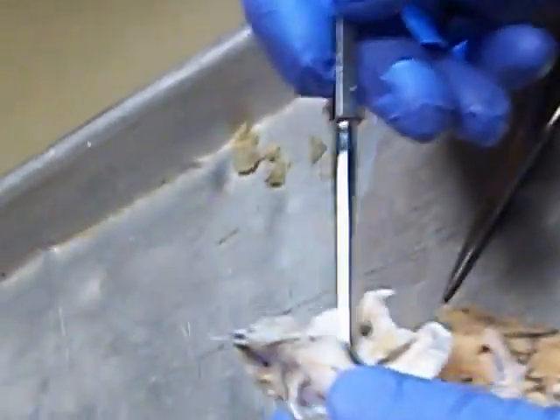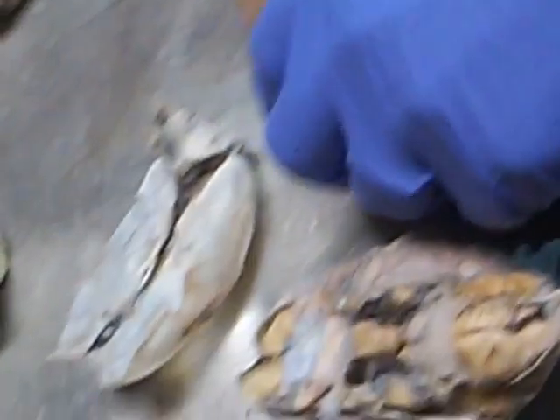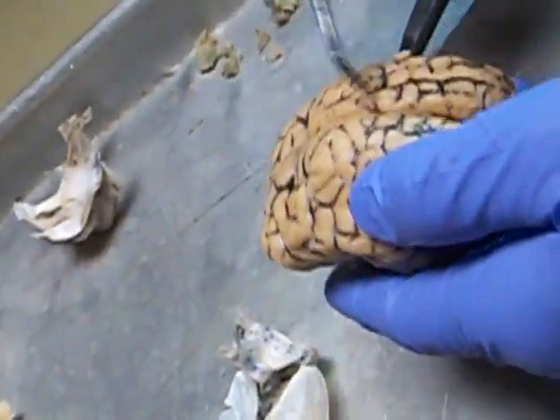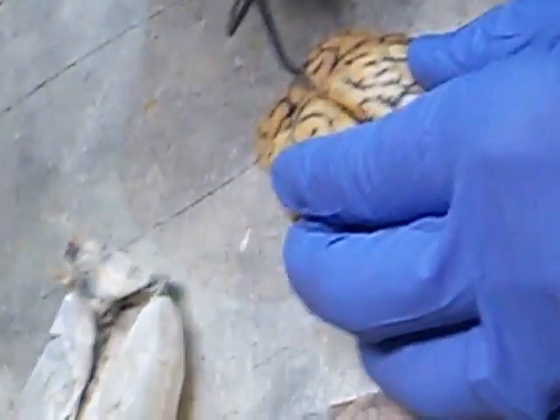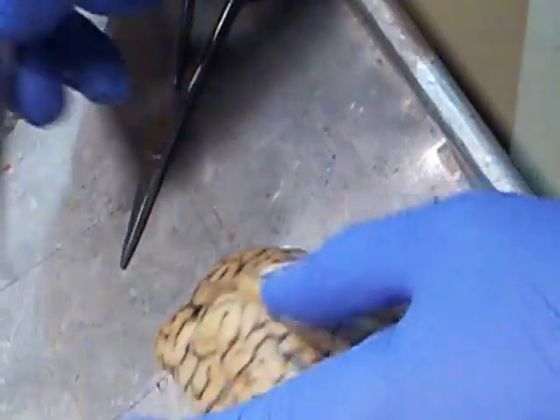Oh, and then here it is right here. How does it fit with the brain? It's going to fit right here in this region. We'll pull it off on that one. Somebody will pull it off nicely, and I'll give you guys some time. You guys can go dissect brains.